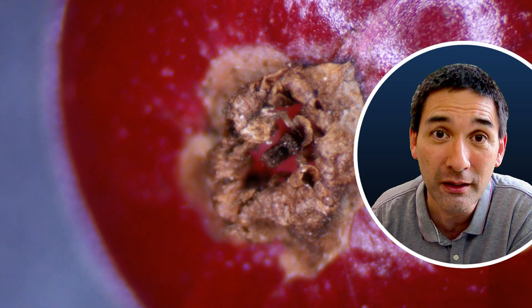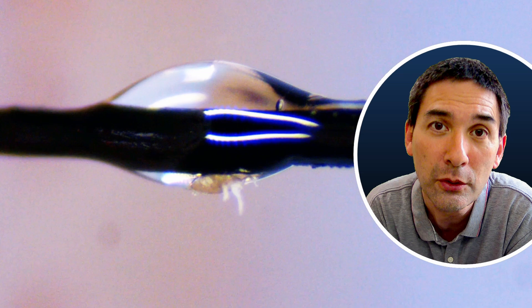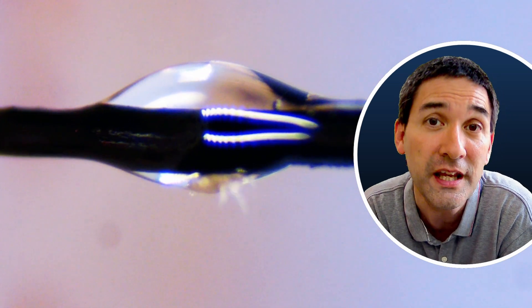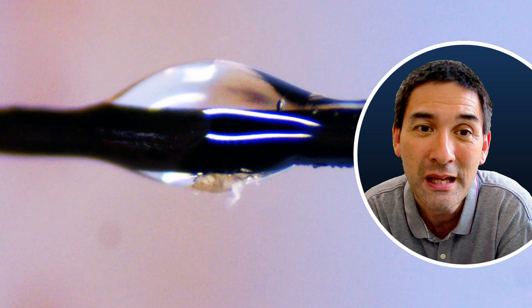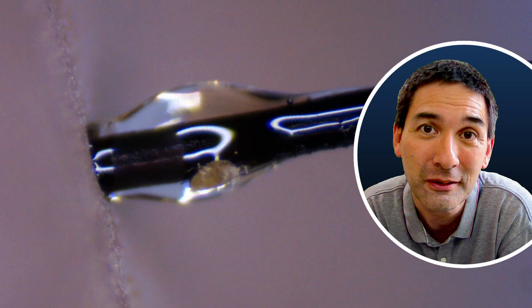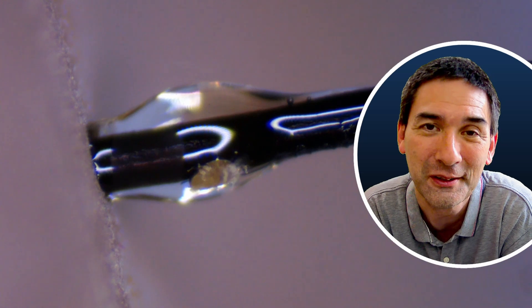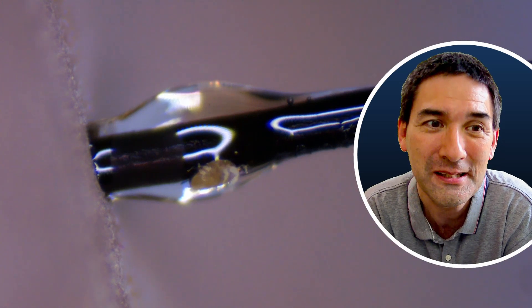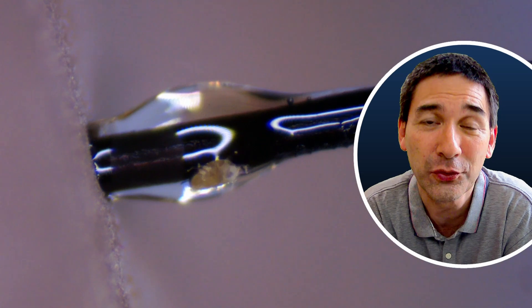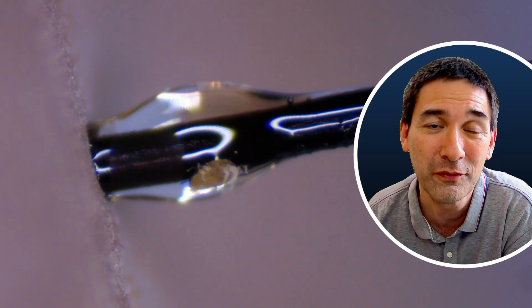This is basically the reason why I've eaten a few hundred of them. What I did was put a little bit of glue on a needle — a PVA glue which I also use as a mounting medium — and dipped the tiny drop of glue onto the mite. This kind of caught the mite. You can see it trying to escape and moving its legs around, but the glue holds it in place. This is how I was able to transfer them onto a microscope slide and make images and videos of them at higher magnification.